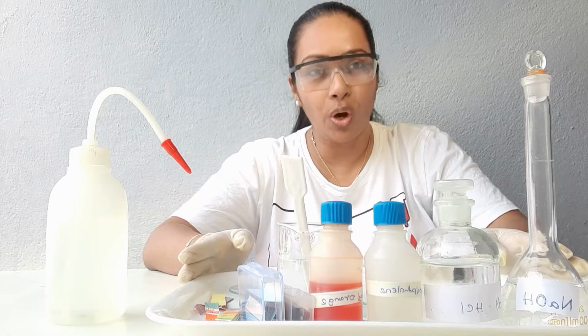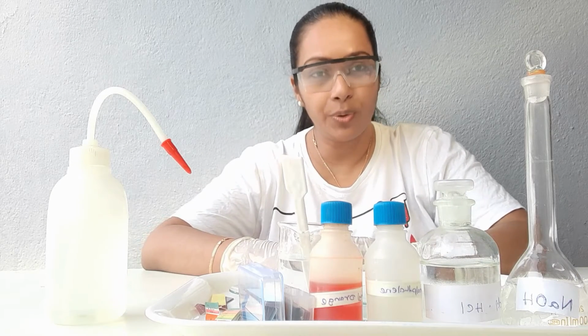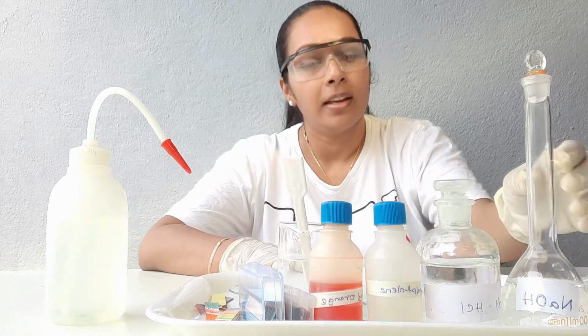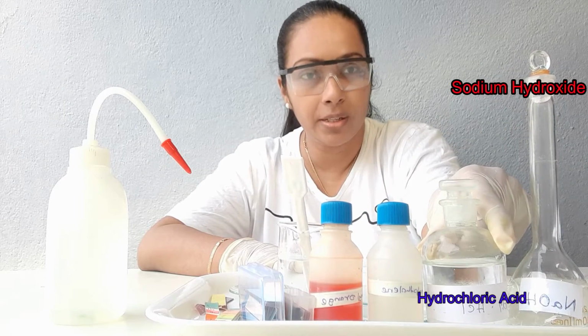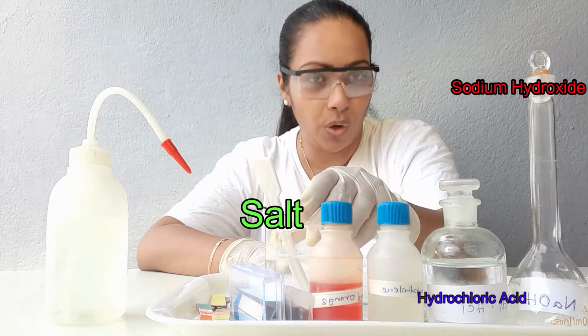Today I'm going to show you all how to identify acids, bases and neutral substances using indicators. I have taken sodium hydroxide, which is a strong base, hydrochloric acid, which is a strong acid, and a sample of salt.